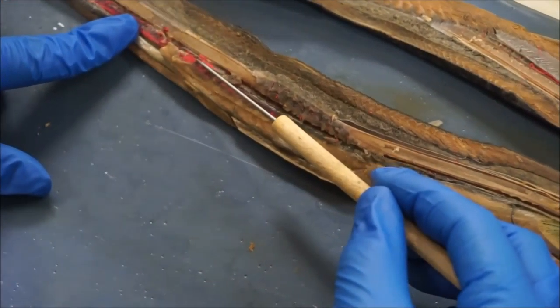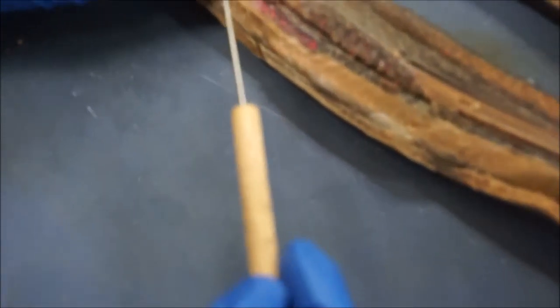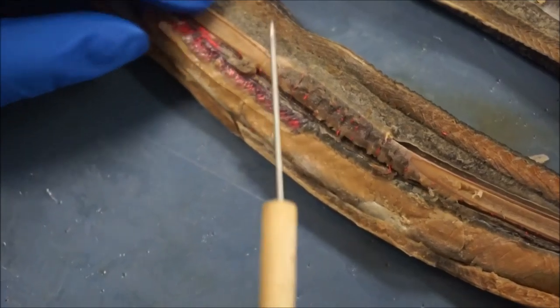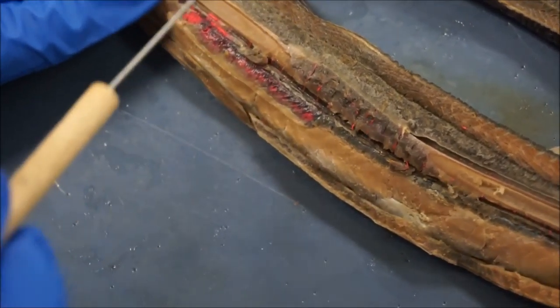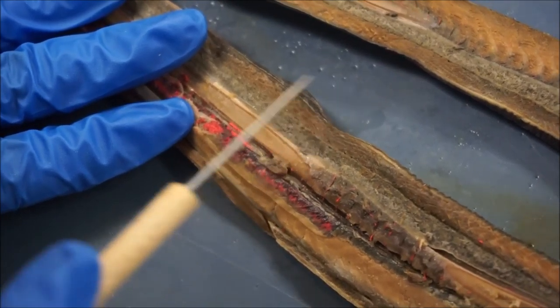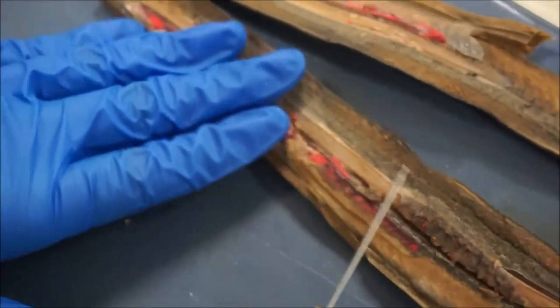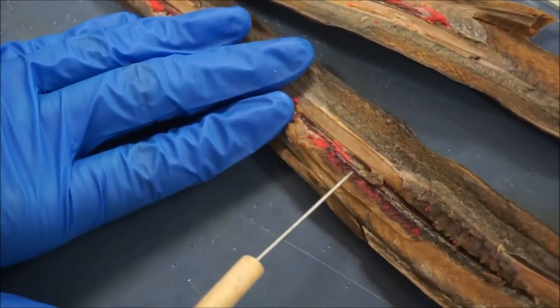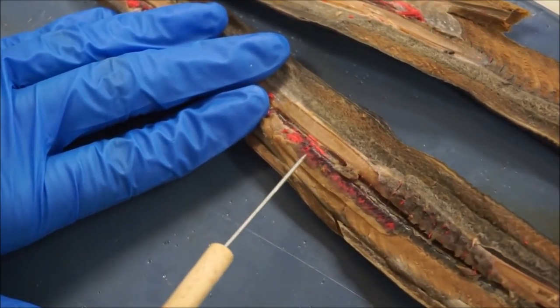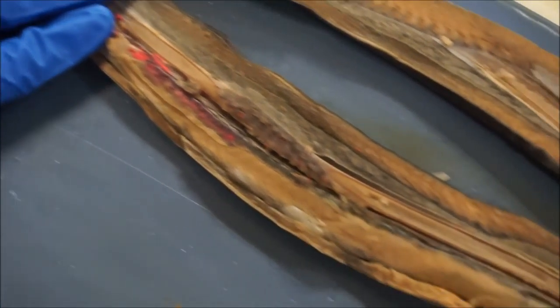This is the kidney of the lamprey — this little piece right here that I'm lifting up. The kidney functions in blood filtering as well as ridding nitrogenous waste and water, and it also plays a role in osmoregulation. Right here, this pink stuff — you can see those are the different blood vessels throughout the kidney that, once the blood is filtered, travel back up into the heart.